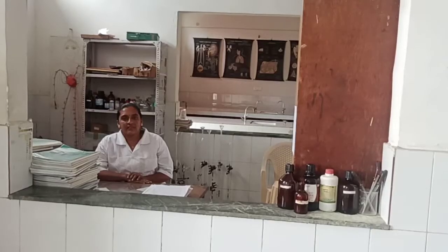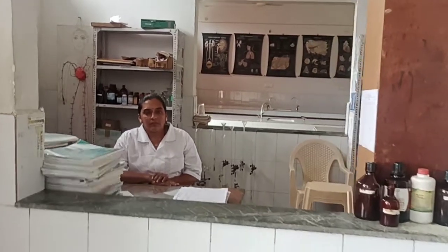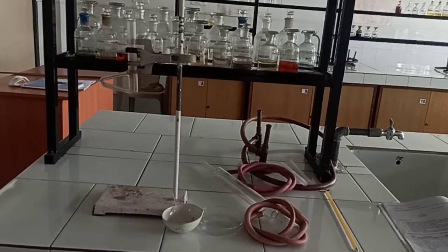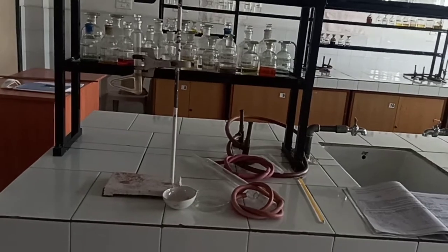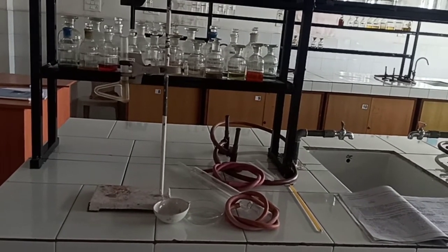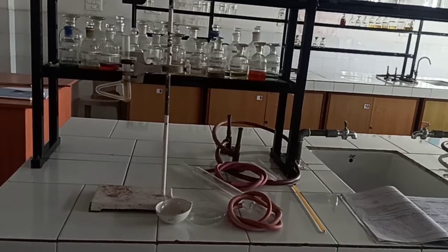And this is your preparation room. Here, Mrs. Deepmalak Haakse, ma'am, is there — your lab technician. For performing Chemistry Practicals, you require some instruments, that we will see.